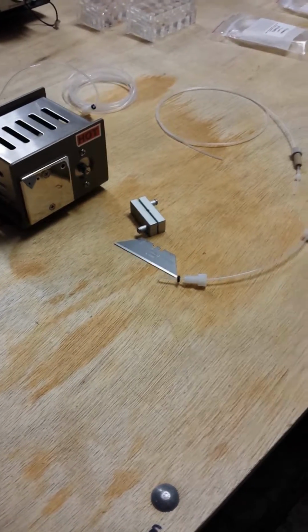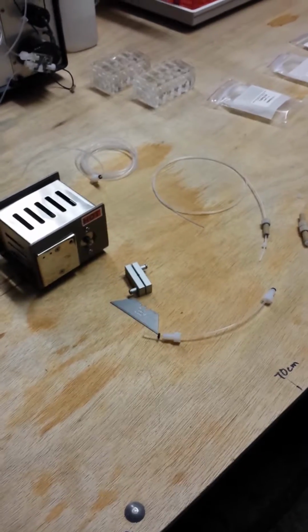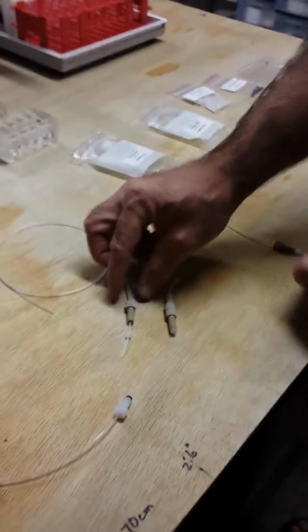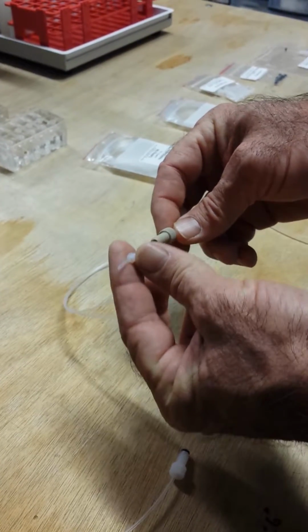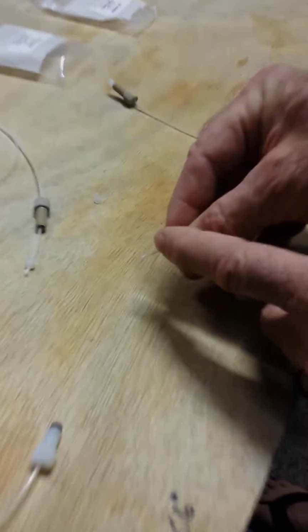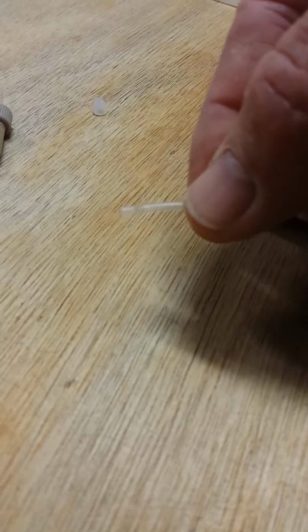So in our videos today, we're going to be focusing initially on the fittings themselves. The first type of fitting that is most commonly seen is a nut and ferrule. They start out loose and then you crimp them down. After you crimp them down, you see that it actually disturbs the tubing. I think it's hard to see, but there's a little indentation there, which over time can be very problematic.